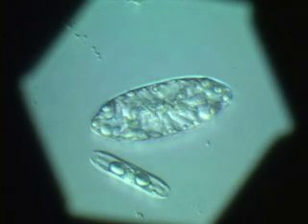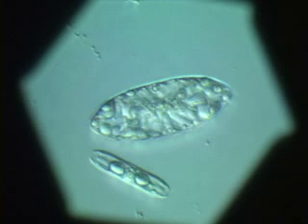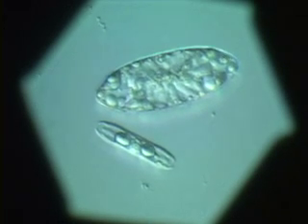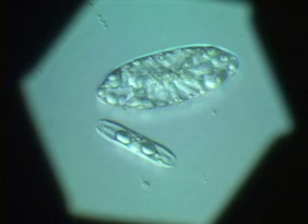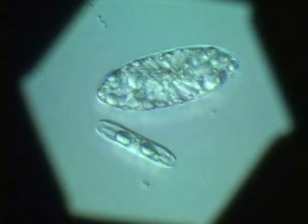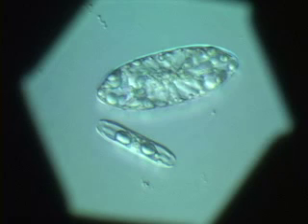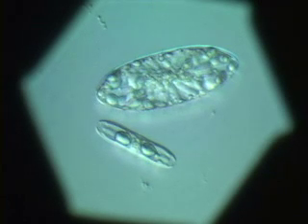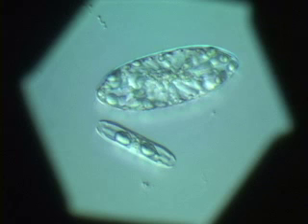The advantage of fixing the cells is that you have stopped any algal growth, and the numbers you will count with these samples are an accurate reflection of what you had seen in the environment. The cells are dead — they don't move anymore, and they also lose their color. In real life these cells would be dark brown because of their pigment contents.